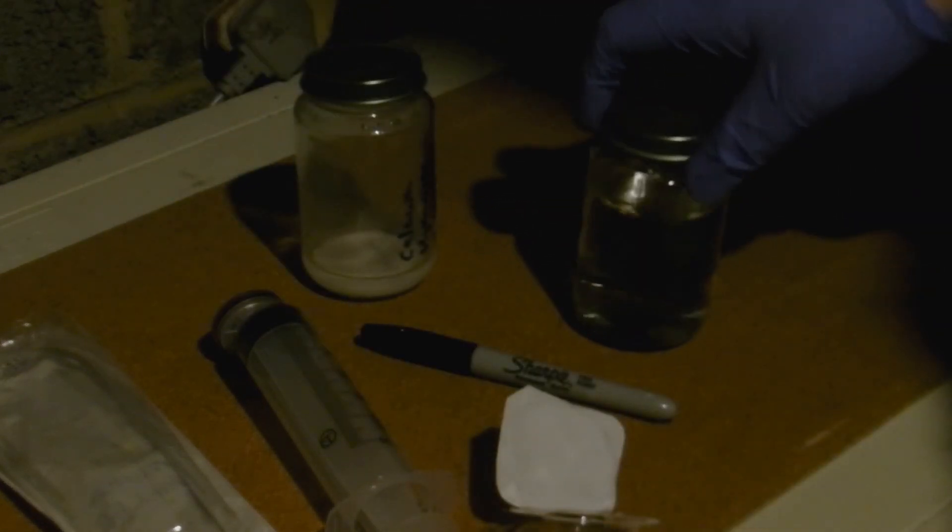And as we've mentioned in the past, always label. That currently looks like water. If somebody was to pick that up they could potentially drink it. We want to make sure we minimize any potential hazards to anybody else. Make sure you label it up. So we're going to put today's date which is the 30th of the 3rd 2020 and we're going to label it lime water.